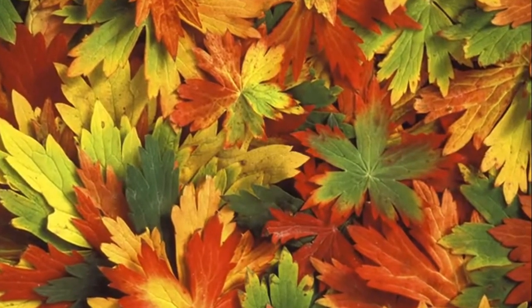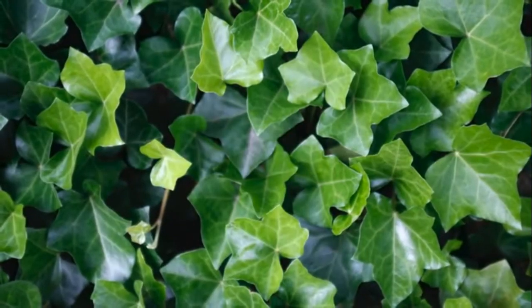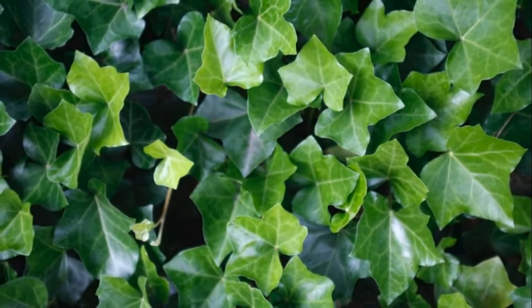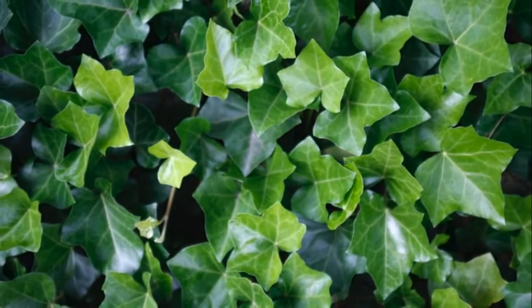Plant leaves contain a mixture of colored pigments. Most leaves are green due to the presence of the pigment chlorophyll. This substance is important in photosynthesis, the process by which plants make their food.